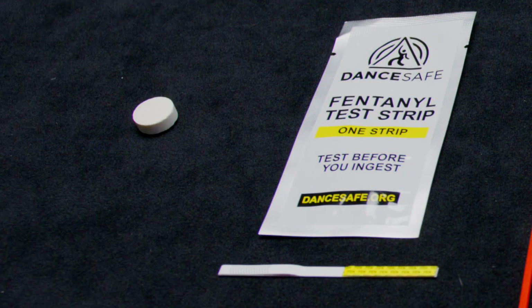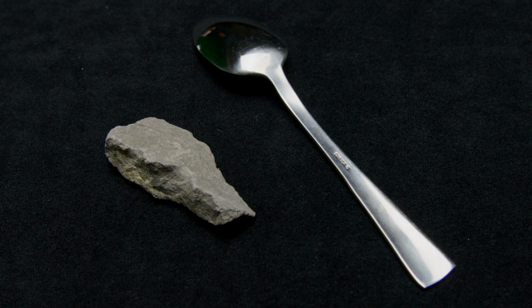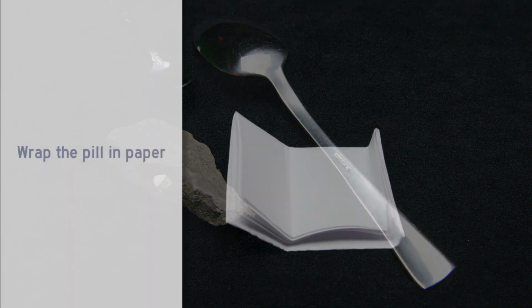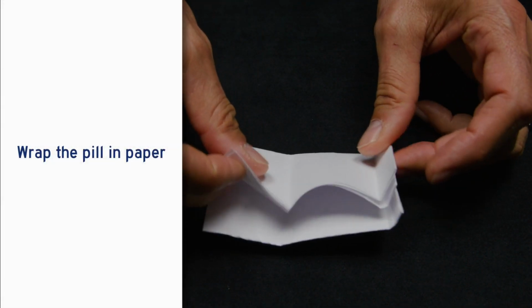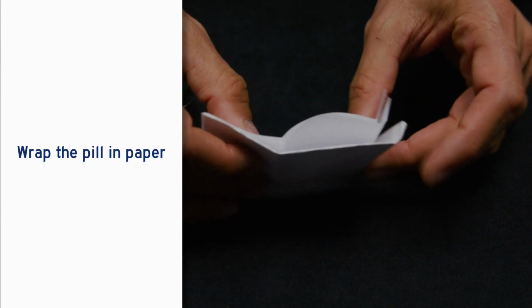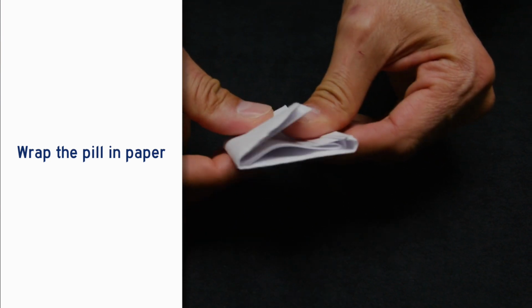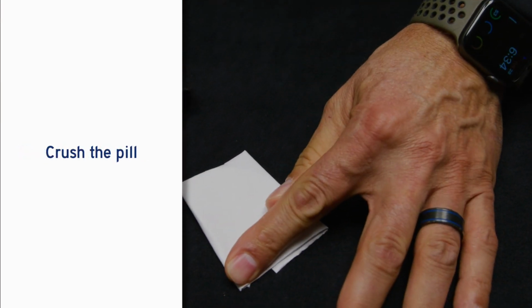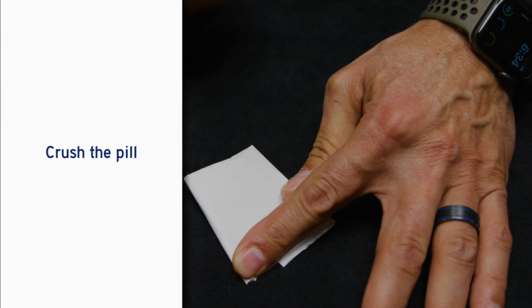Now, let's look at how to check for fentanyl in a pill. First, we will need to crush the pill. This can be done with a solid, hard object, such as a rock or the back of a spoon. Wrap the pill in a piece of paper, folding the edges, and place on a table or on the ground. Apply enough pressure to crush the pill inside the paper.